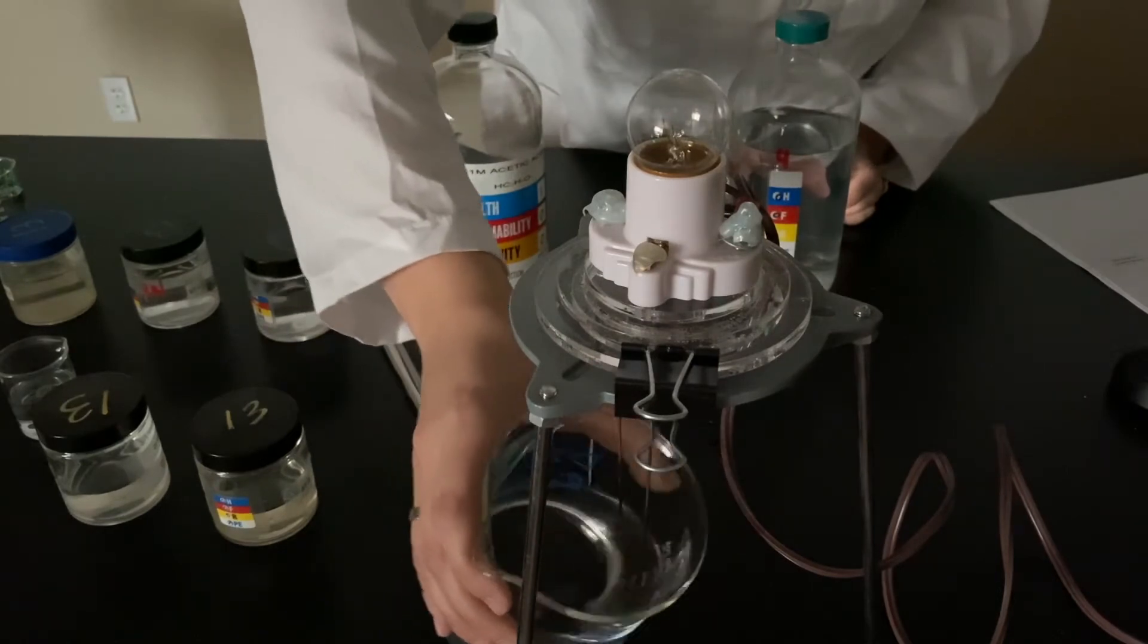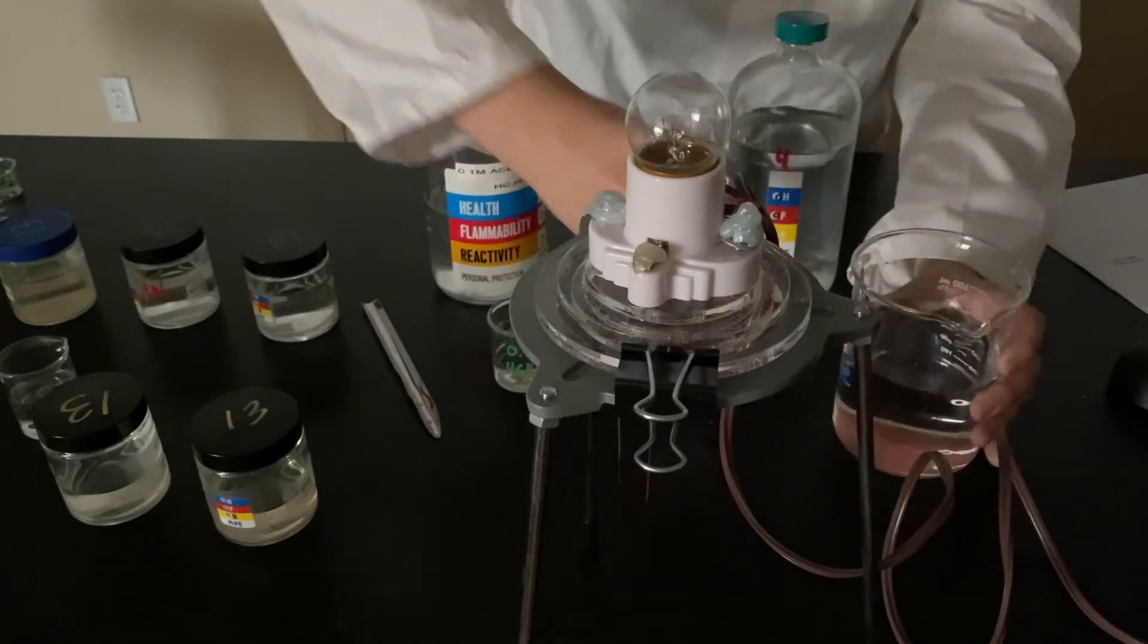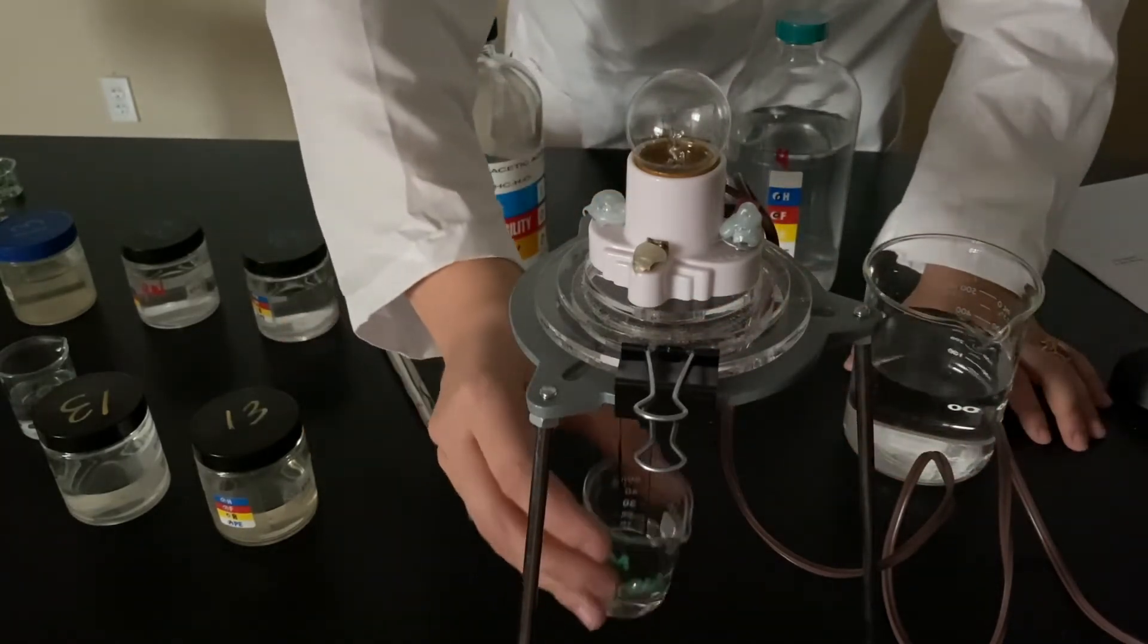Let's rinse this off. And here's 0.1 molar ammonium hydroxide.